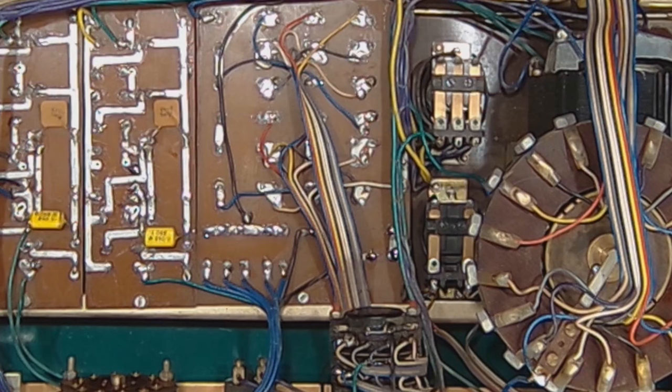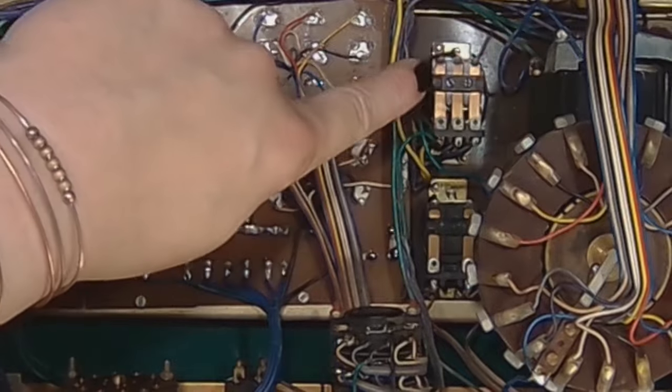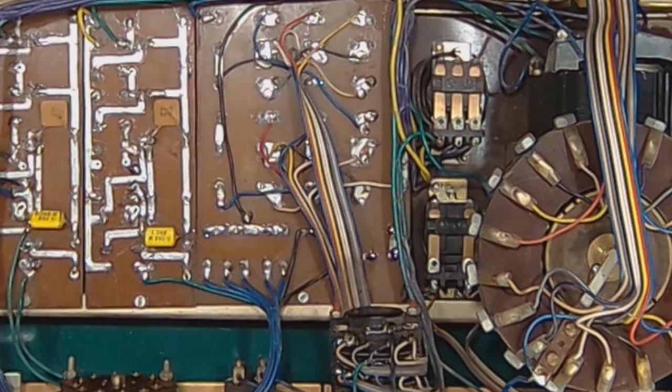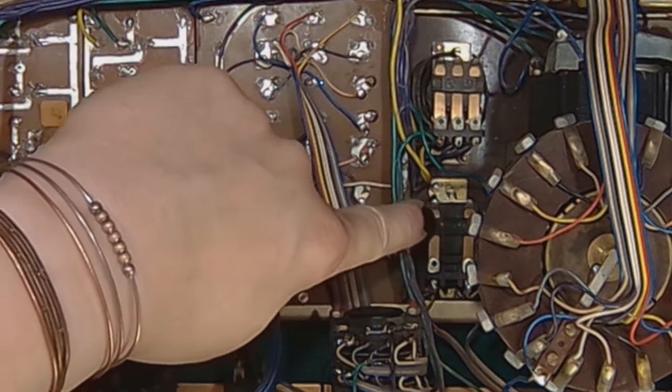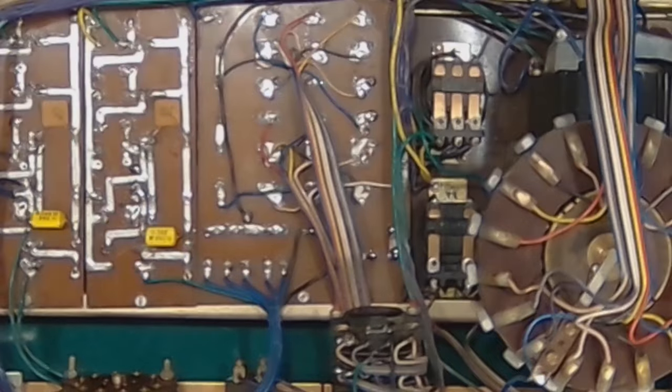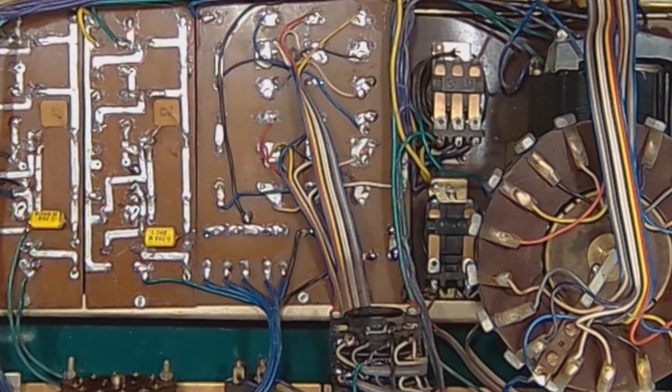Turning the shock voltage on, this will come on. But I will release the button now, and you will see that this relay will act and almost immediately disengage. Pretty interesting.